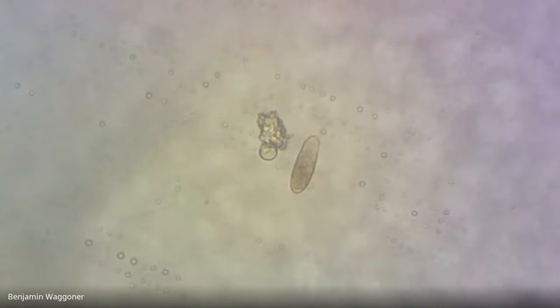Okay, that really small spiral-looking thing could be one as well. Let's try to zoom in on this one. Yeah, I think that's one of the ones we were already seeing. I think he's just slowed down a little bit, probably because he's about to die. It happens.